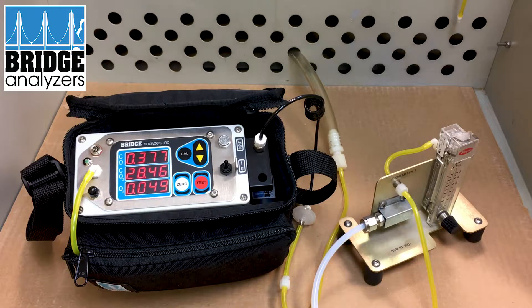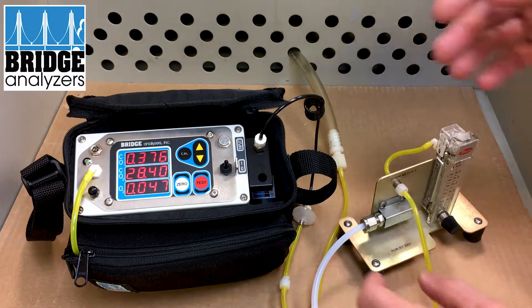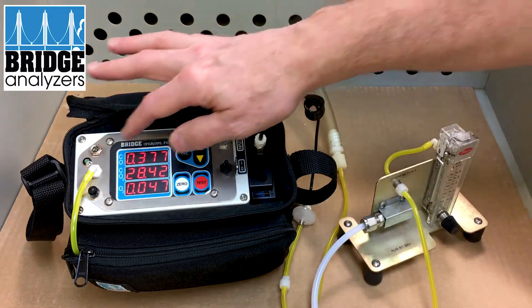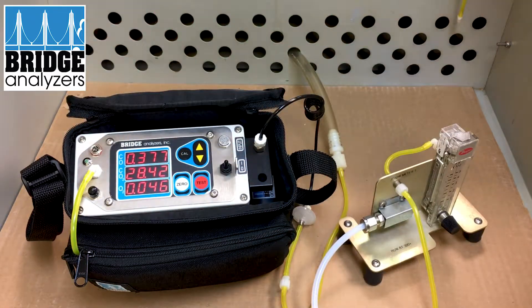We've given the analyzer a little bit of time to stabilize. We actually hit our five-minute zero, so we re-zeroed. Our numbers look pretty stable now, and if you have a thermally stable analyzer you can go into calibration mode. First, you have to be in continuous run mode — that's a common mistake people make. If they're in test-and-hold mode, the analyzer will not go into calibration mode.